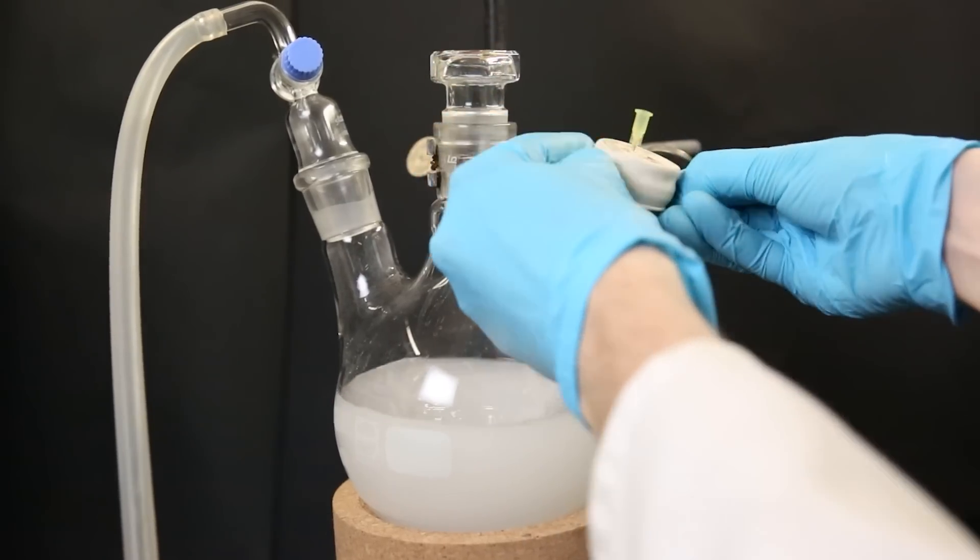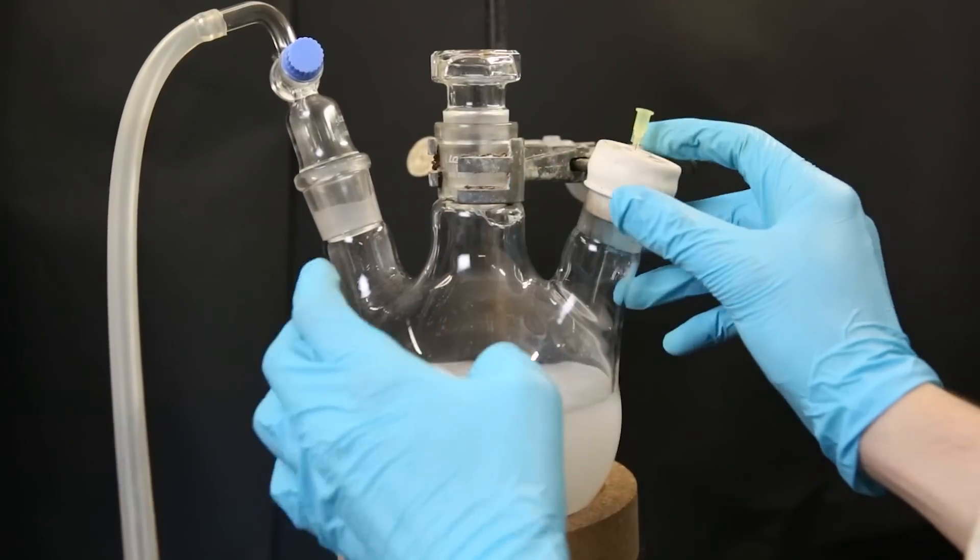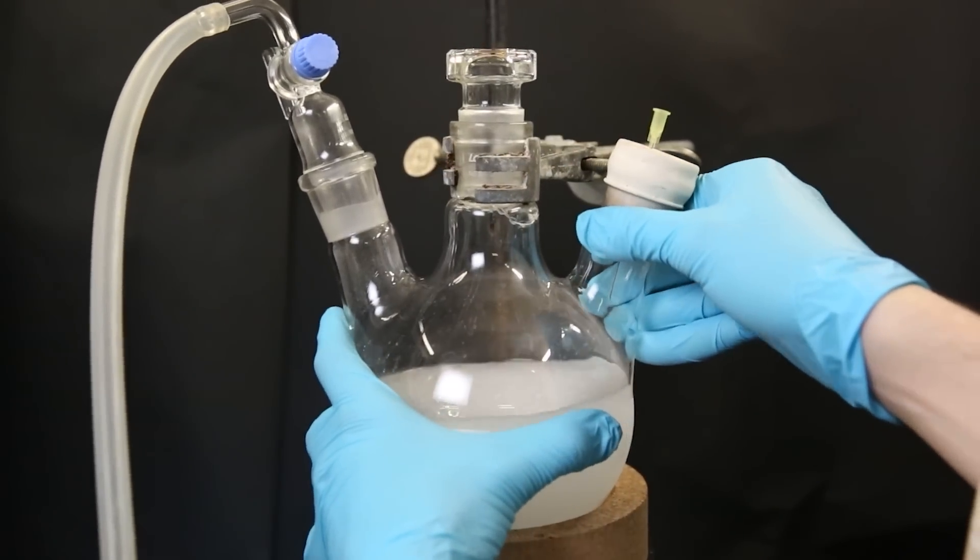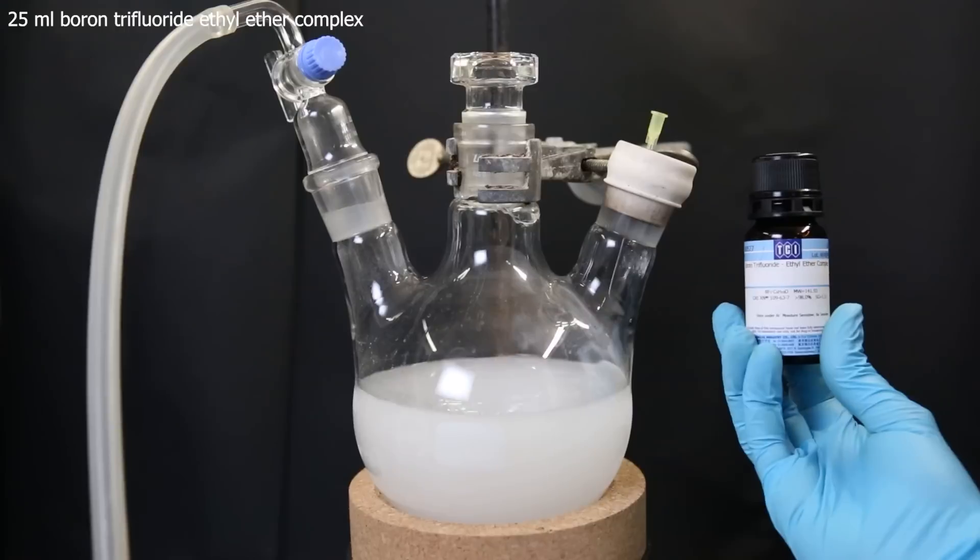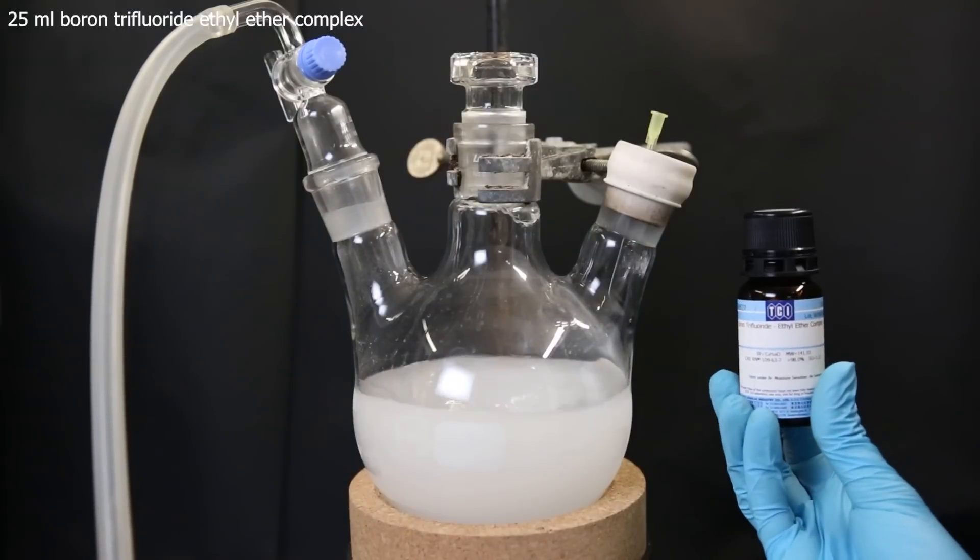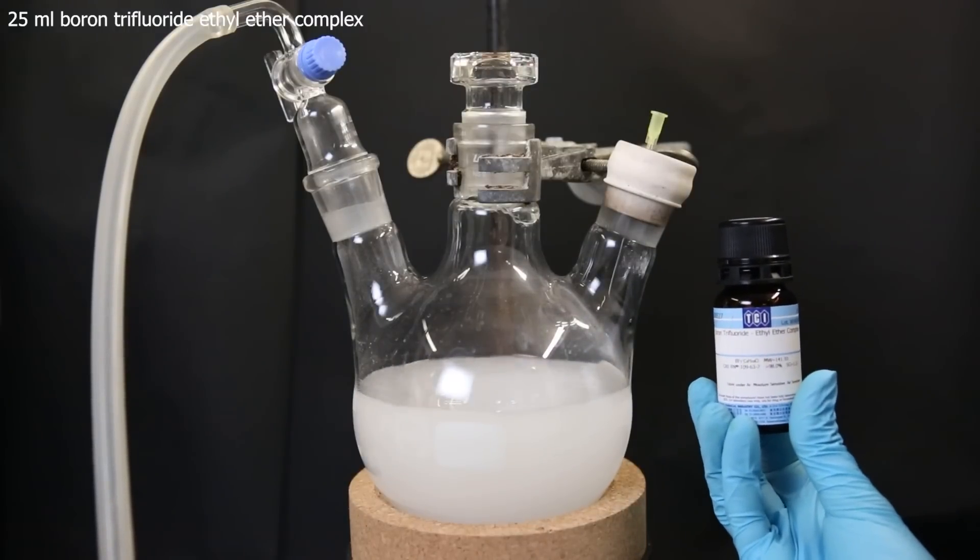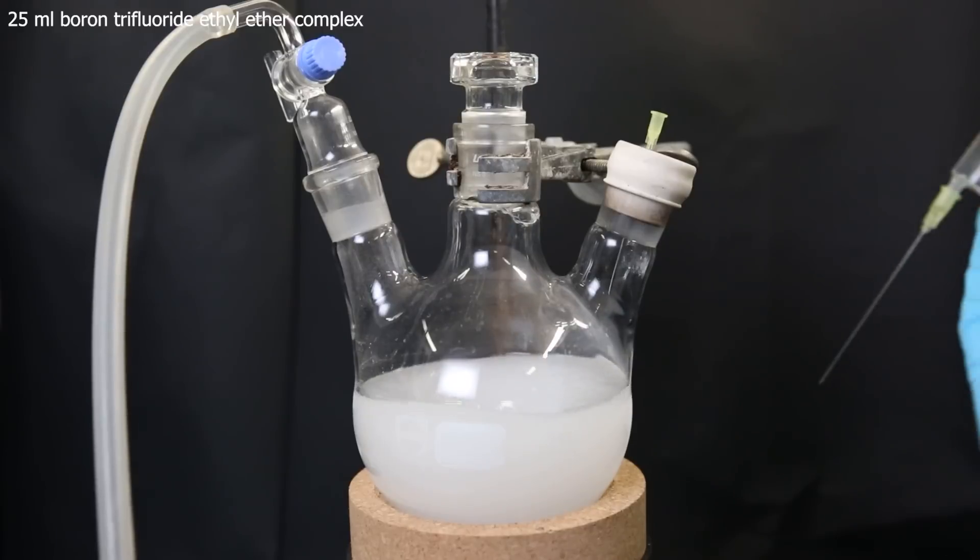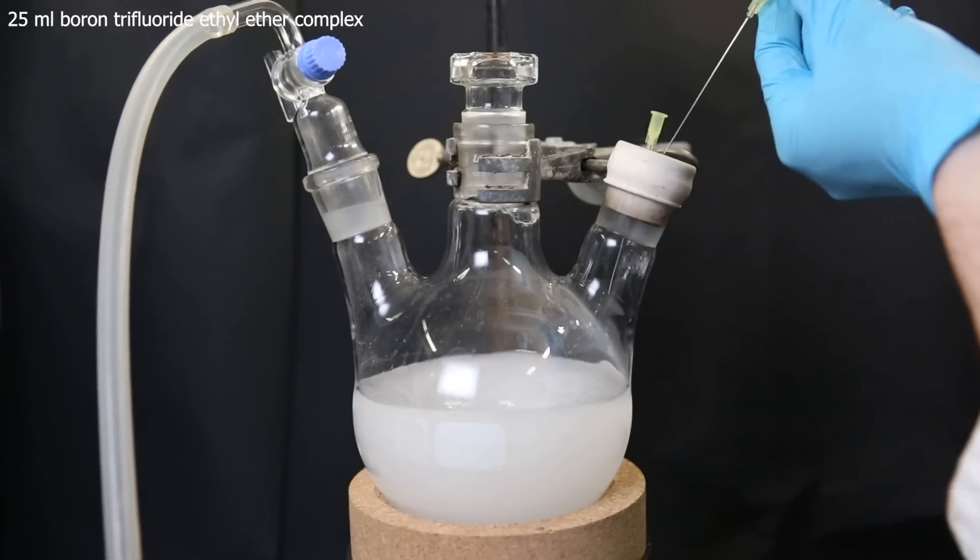Then I remove the funnel and put a septum with a needle in its place. Now I will add in 25 ml of boron trifluoride ethyl ether complex, which again is the whole bottle. But this time, I will inject it into the setup.